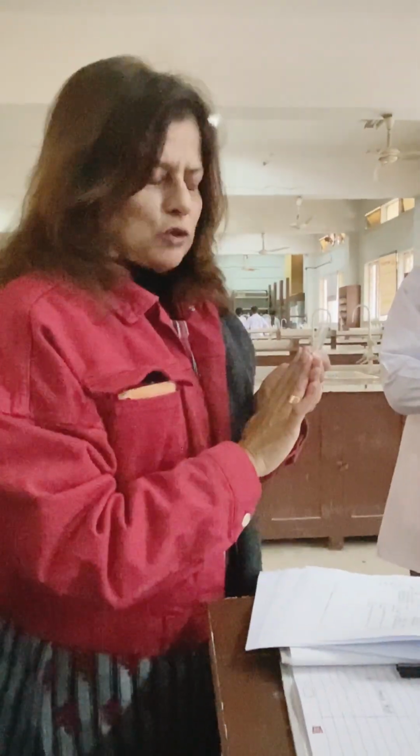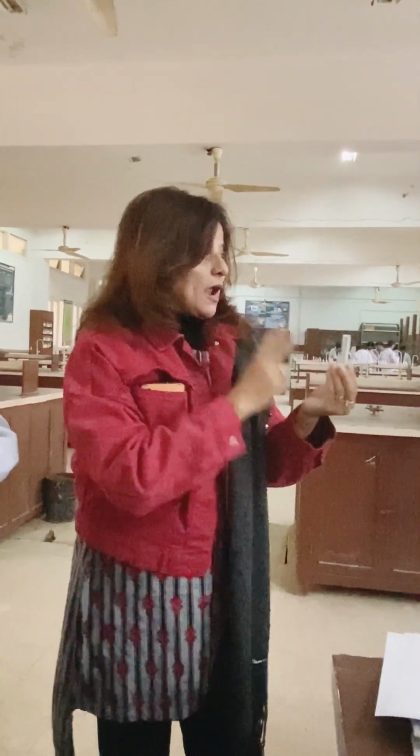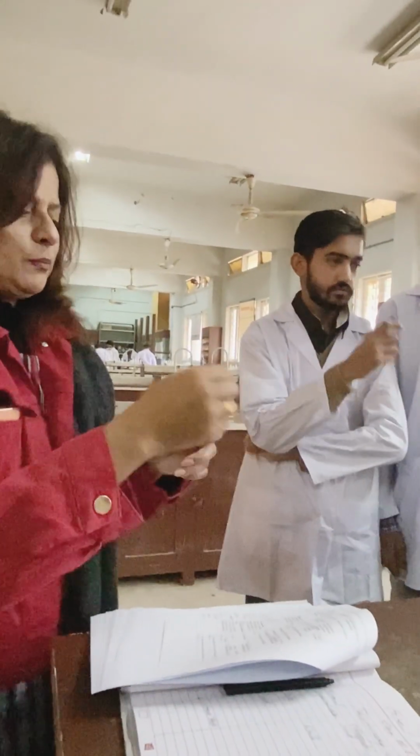No, it's not a solubility, sorry. When it gets dissolved, what you are going to do, you have 2 litmus papers, blue litmus paper and red litmus paper, blue and red. You are going to take out a strip, a small strip cut from the paper, small enough to go inside easily.